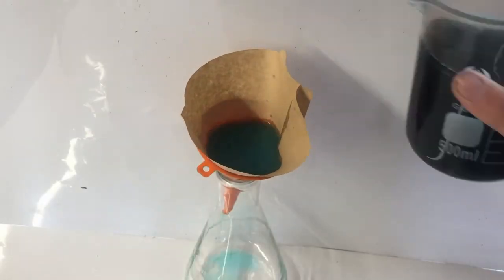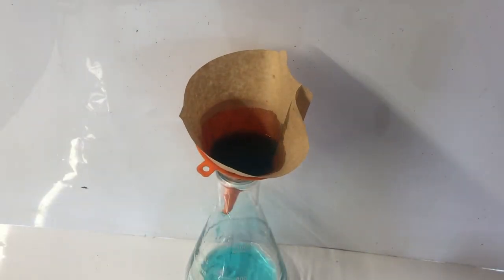After leaving the reaction to run overnight, it had finally cooled down and two distinct layers had formed. Underneath the water, it was obvious that some bits of copper had been completely corroded.